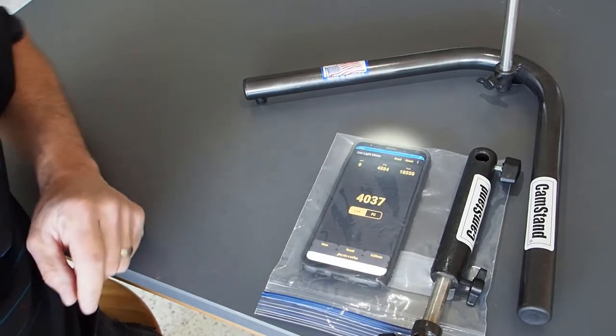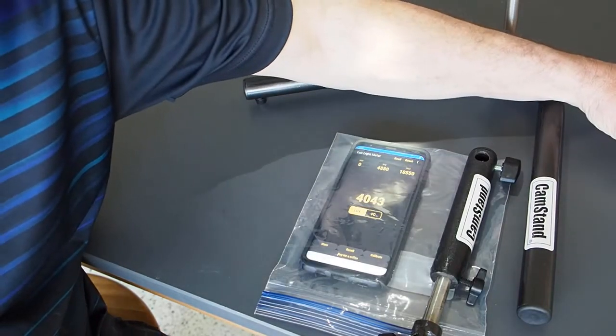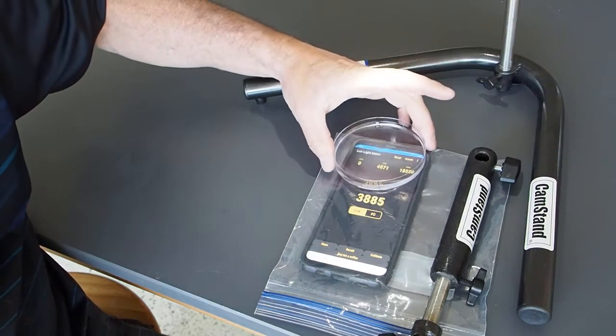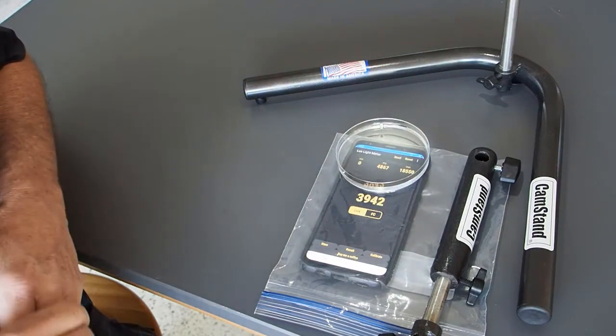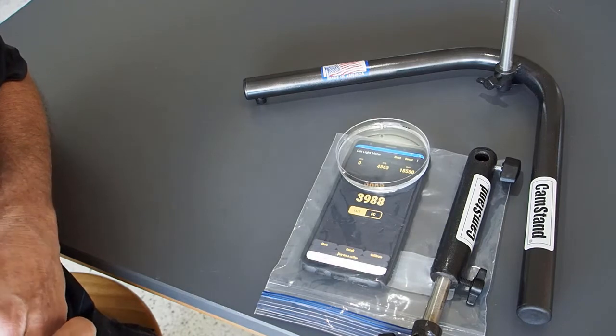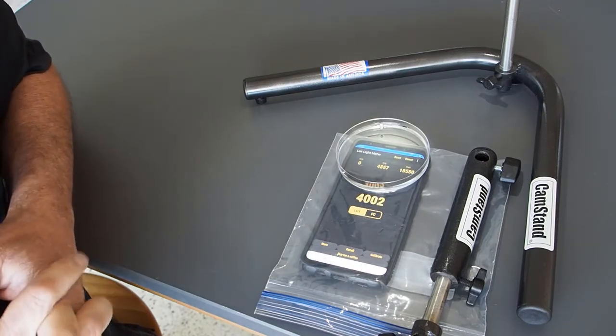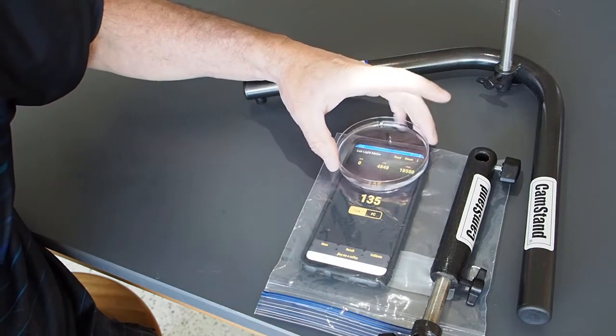Okay, so now we're going to test our samples. We have 30 milliliters of each sample in a Petri dish. So 30 milliliters of just water first, and we put that on here. The reading is around 3,900, almost 4,000, around 4,000, let us say.